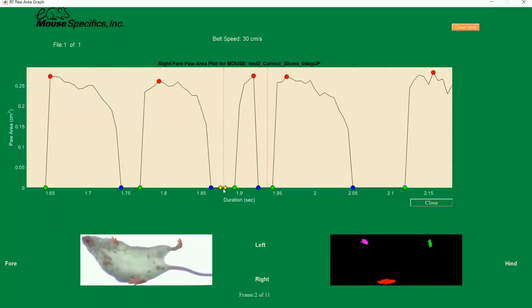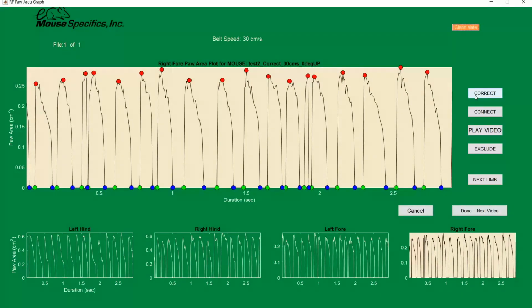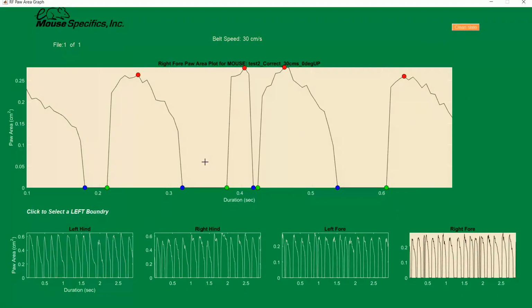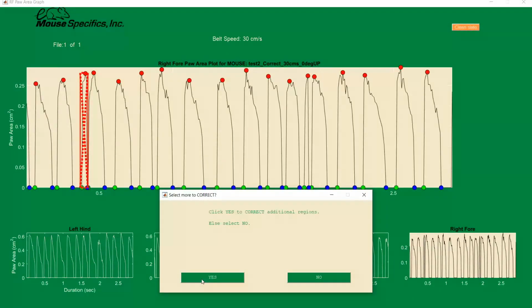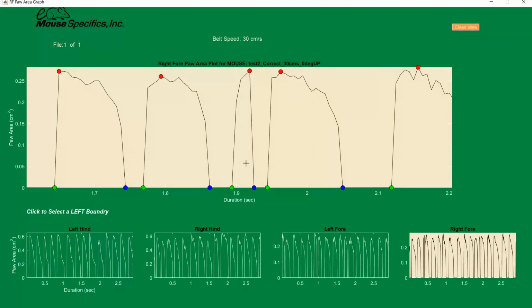Using the play video again, we can see that the software identified the right forepaw as in stance phase, when in reality the raw video shows us that it is in swing phase. This is the same as the other noise we just looked at, and we will also want to edit it the same with the correct. Select the correct button and click once to zoom in on the first noise. Then click once to the left of green and once to the right of the blue. Since there are more than one correct here, this time on the pop-up, we will want to select Yes when asked if there are additional regions to correct. We can go through the edits one by one until we have finished.